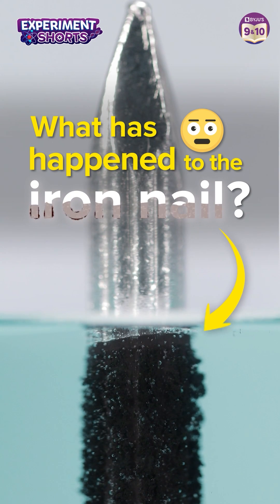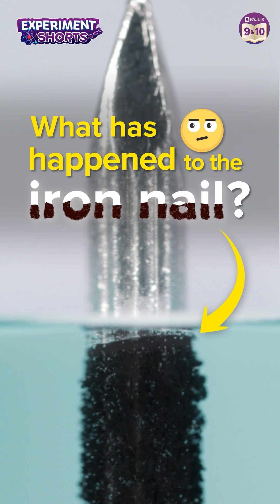Hey, what happened to the lower half of the shiny iron nail? Let's find out.